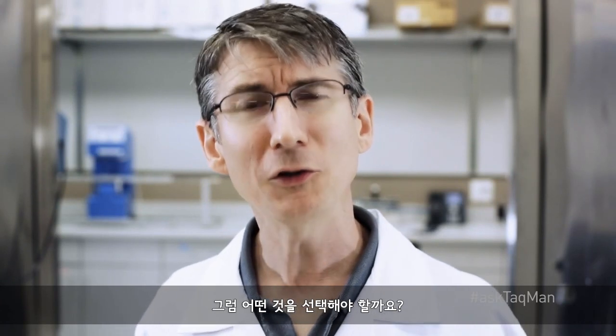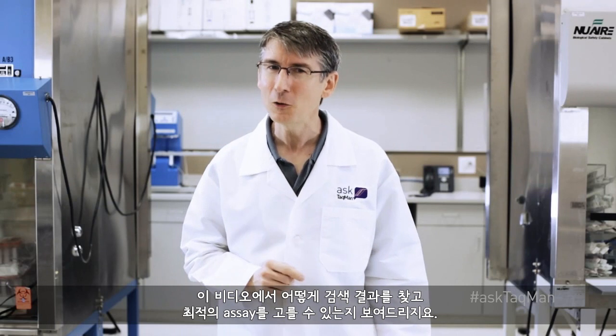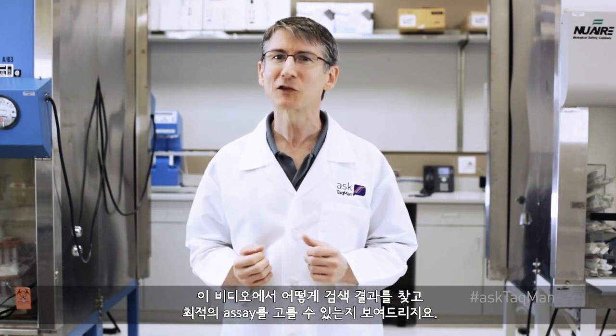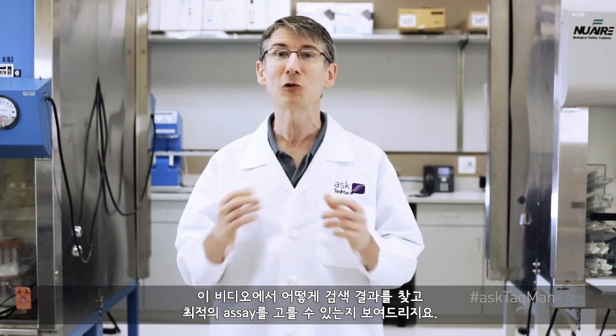So how do we know which one to choose? Well, that's why in this video we're going to look at how to navigate search results and to pick the assay that best suits your needs.